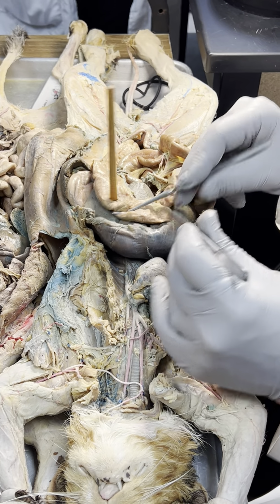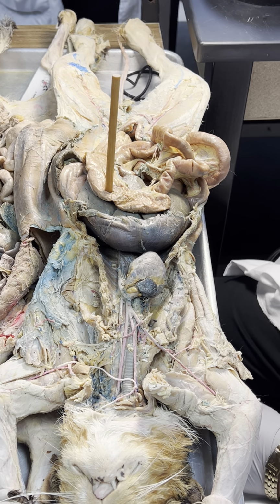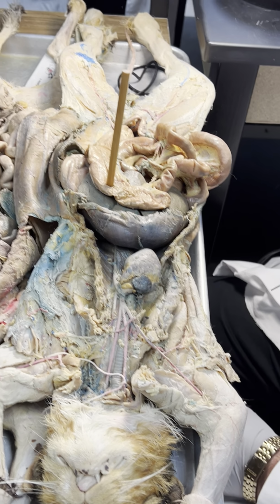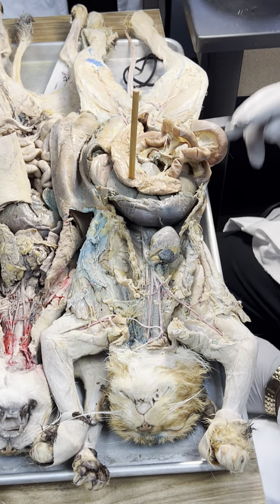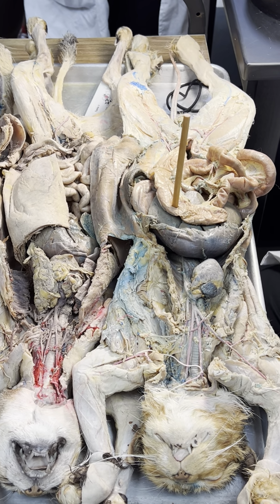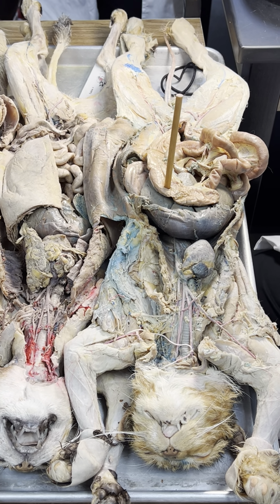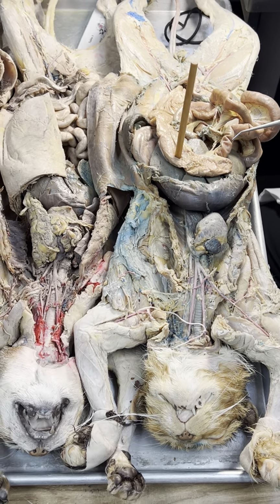I'm going to pin the colon to the liver just like this, and I'm either going to put the pin here or here. I got 3 AP2 classes. One class I'll pin it here. The next test I might take it out of there and put it over here, because that's so easy to do. It's no work for me to do that. So expect to see that. This or this one.